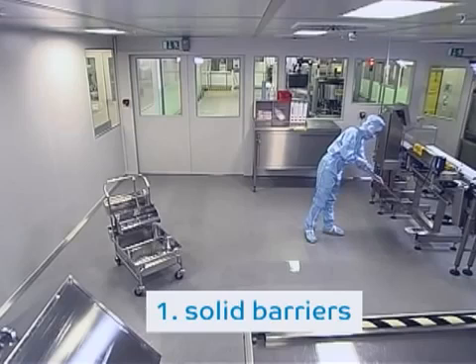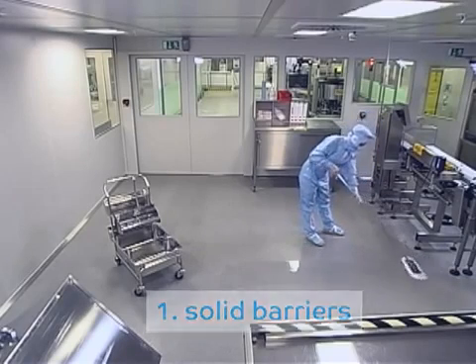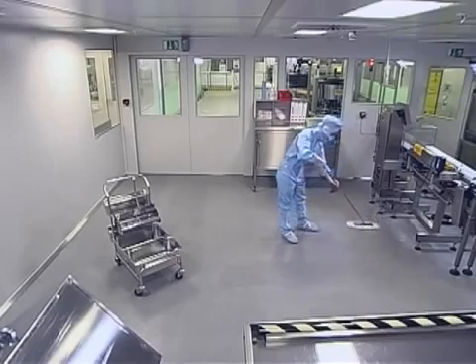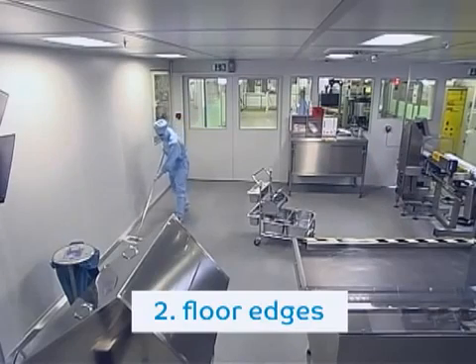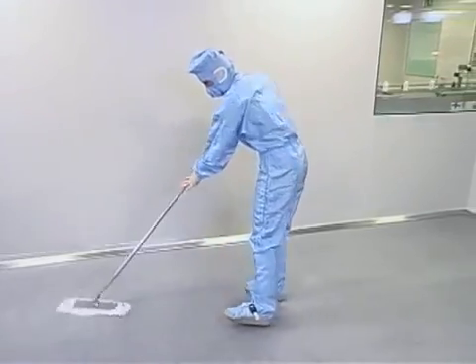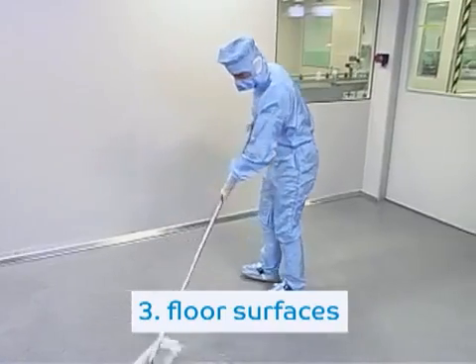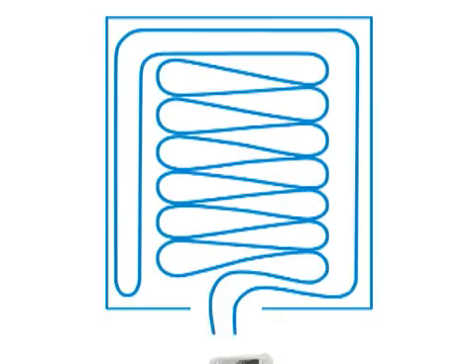Start wiping solid barriers, such as machines, and wipe around them. Continue with floor edges. Wipe in a line along the wall up to the most distant site of the room. And from there, start wiping the floor surfaces, moving backwards and in a figure of 8 shape.